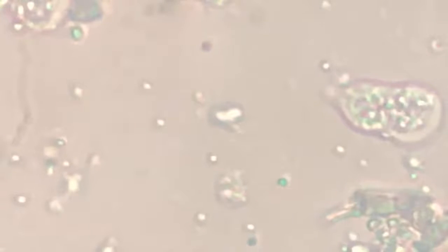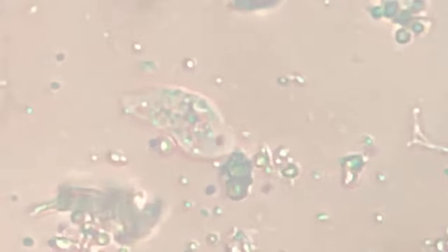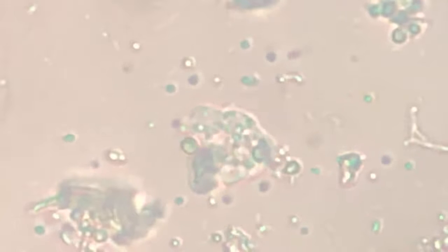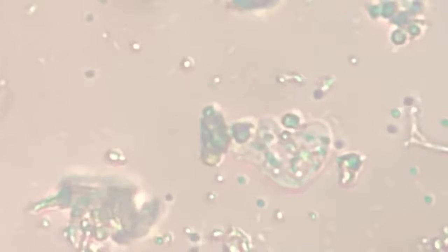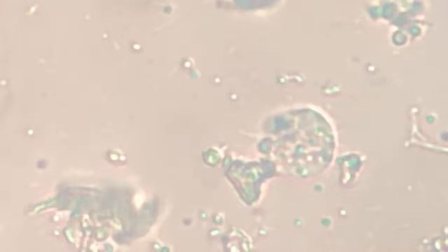At 7 o'clock side, there is a rod. In fact, all that we see are probably rods. They are upside down. Will it eat something more? It just tried to grab this algae and probably it is ingesting it. No, it left it off. Just went forward, bypassed. That big chunk of algae it has left, probably it was not that tasty. And there are smaller algae particles, many bacteria around. Probably that algae has been ingested because it is sticking with the body.